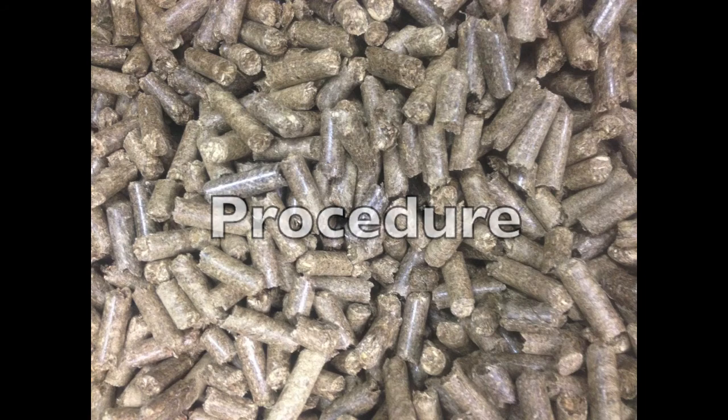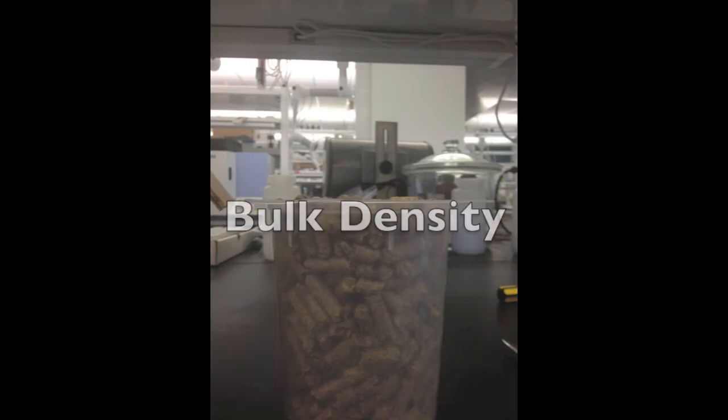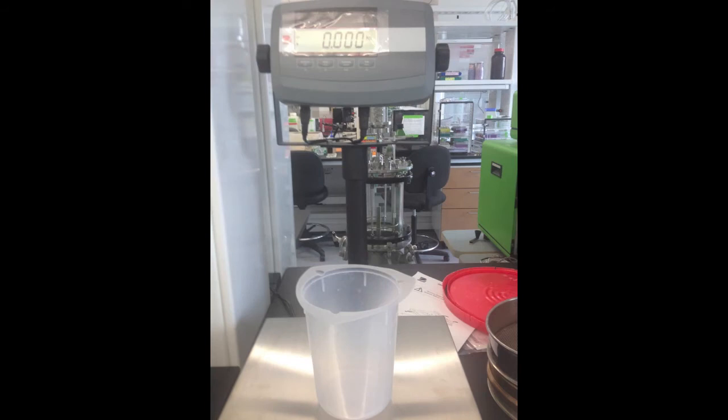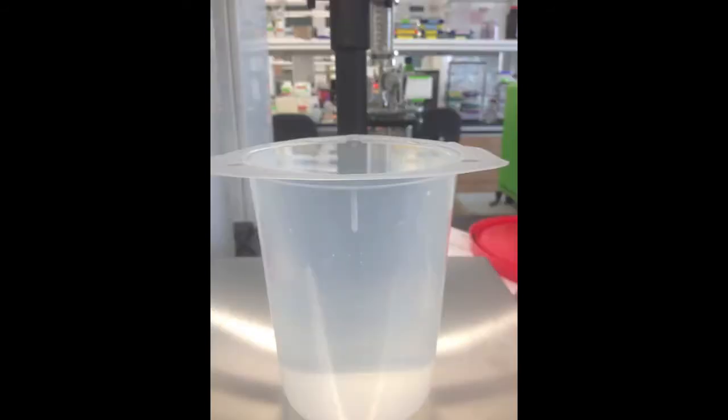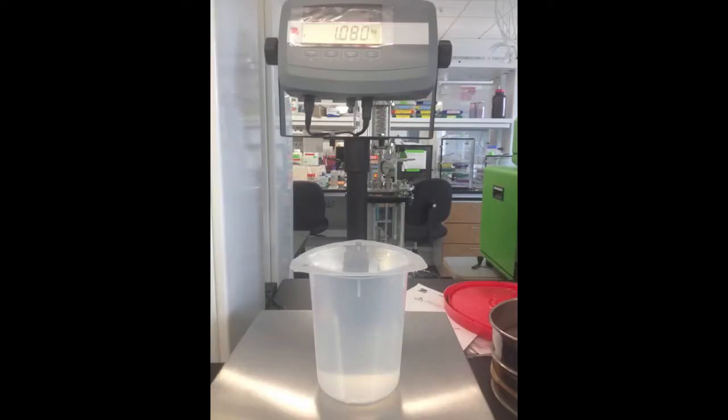Now let's go over the procedure. The first property you will measure is bulk density. Start by obtaining a container capable of holding at least one liter and record the weight of the empty container. Next, determine the volume of the container. To do this, tare the scale and fill the container to capacity with water. Using the mass of the water, determine the container's volume. Remember, one milliliter of water is equal to one gram of water.